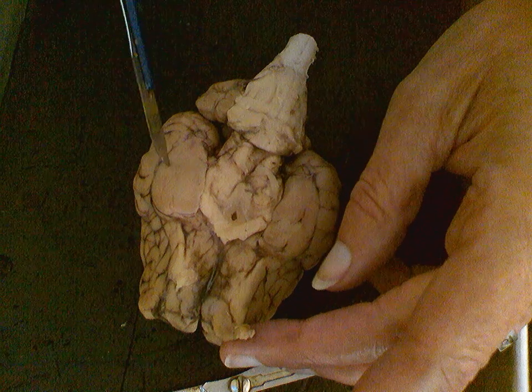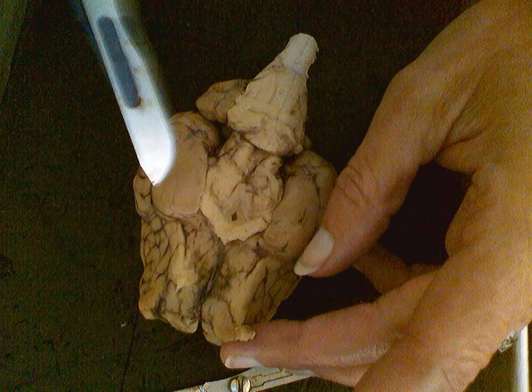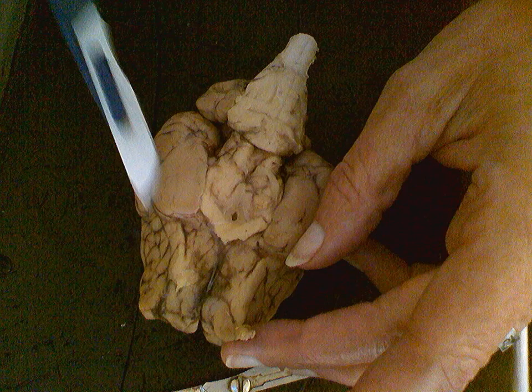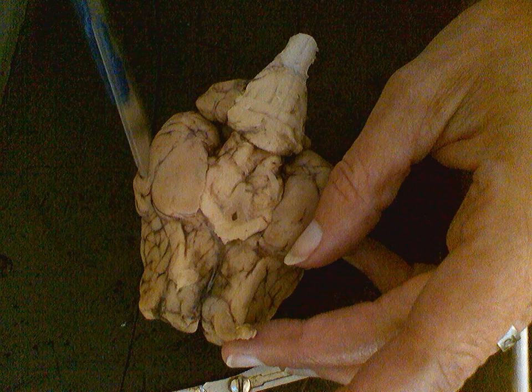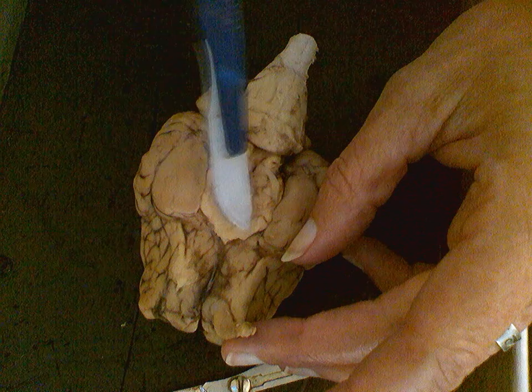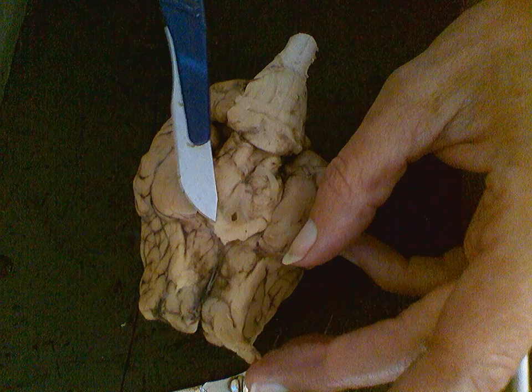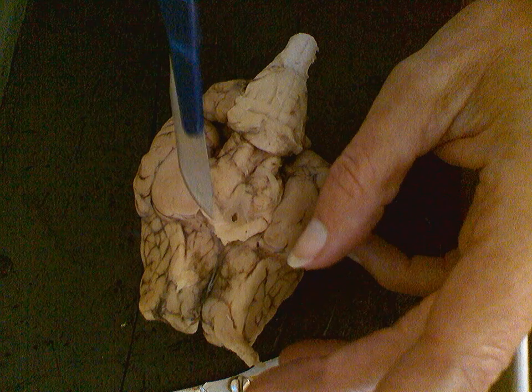Remember that we really are looking at two colors. We have white matter and we have gray matter. So remember that for our next topic when we look specifically at the neurons. But we also look at these large areas of white matter. We very often call them a tract. So a white matter tract. Now I'm going to stop here so that I can set up for the sagittal cut and look at the interior structures from that view.